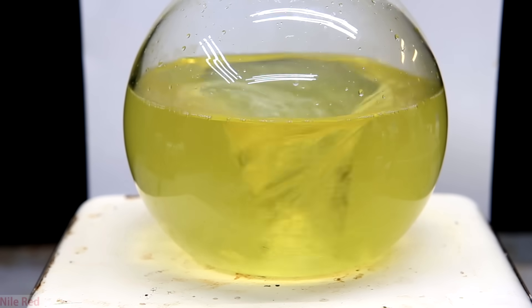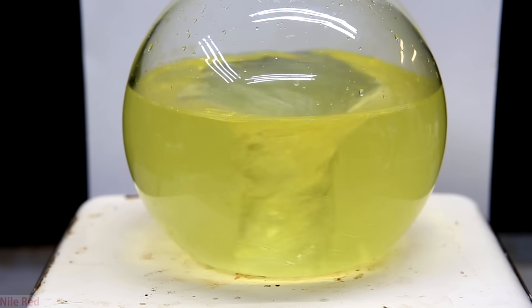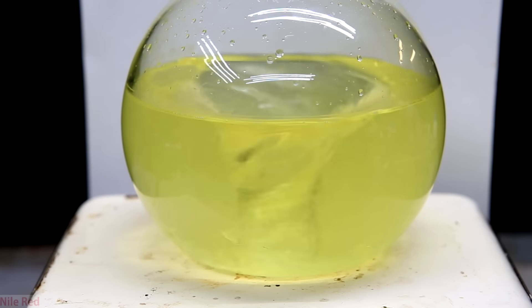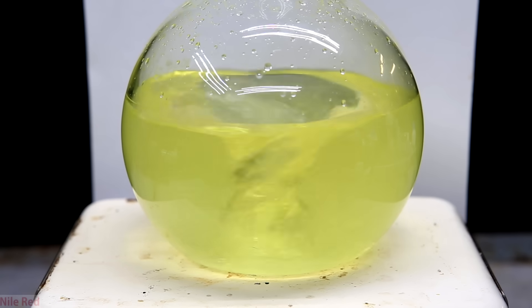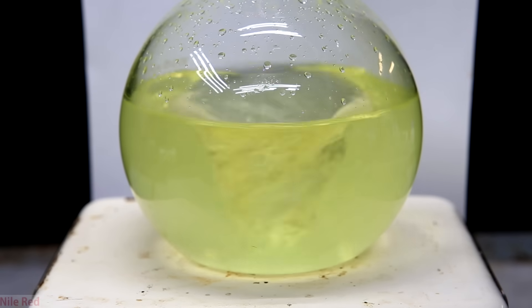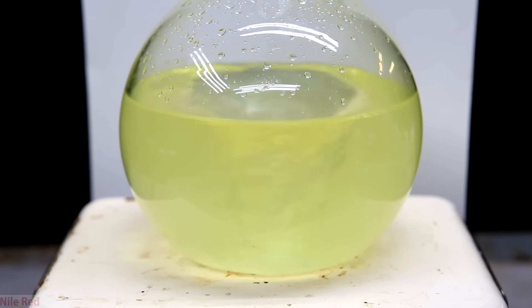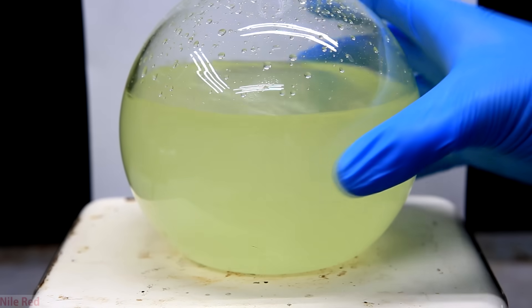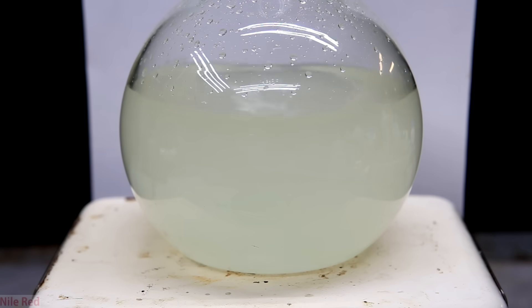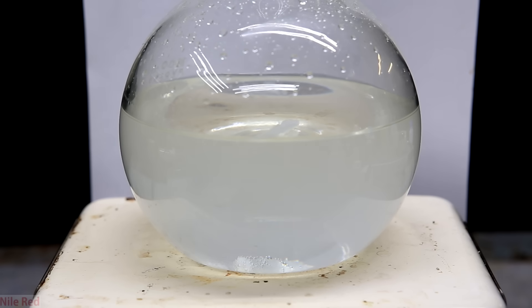The first question is: why was the acid even green to begin with? The companies that make these drain cleaners include things called inhibitors — organic compounds which prevent the sulfuric acid from corroding metal pipes. When the drain cleaner sits in the pipe, without inhibitors it might attack and degrade the pipe. The Caro's acid we're making is a super strong oxidant, and since the inhibitors are organic compounds, when a strong oxidizer meets an organic compound it undergoes complete oxidation — completely destroyed and converted into water and carbon dioxide. The CO2 bubbles out, but the water stays. I also heated the solution to about 50 degrees Celsius to speed things up.